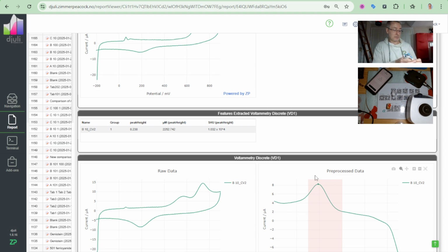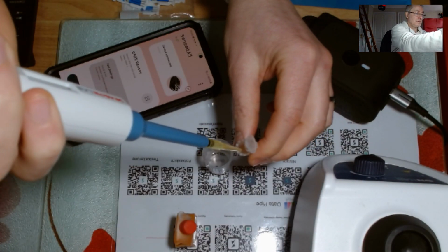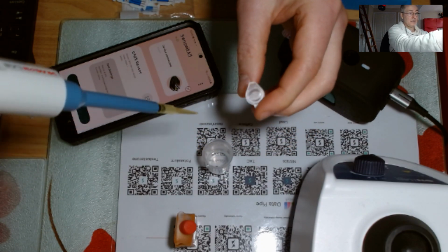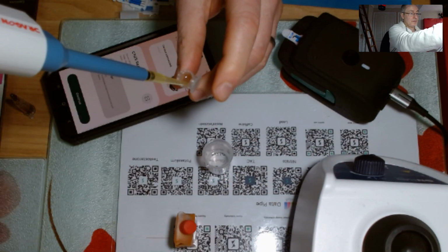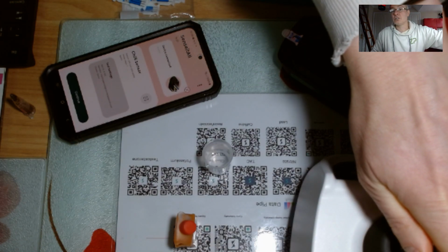So let me just, what I actually want to do is I'll name this B100s because that will help me identify it clearly later on. That'd be good. Here's the sample. I'll take, and I might go to a bit different screen. All right, so I've got 10 microliters of that. I'll just put it back in because I think I should have done this first. I should have just given it a quick vortex, make sure I homogenized it all.